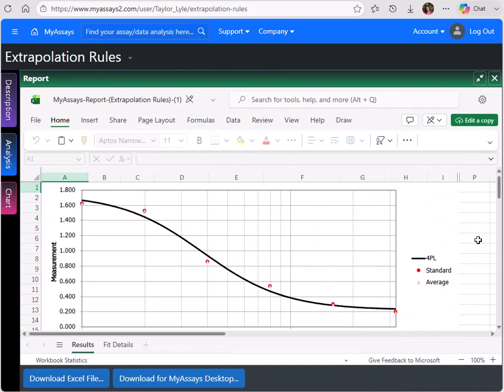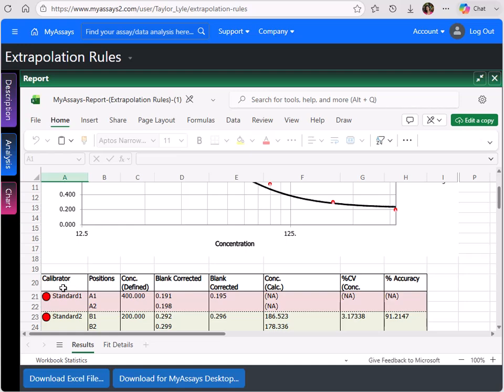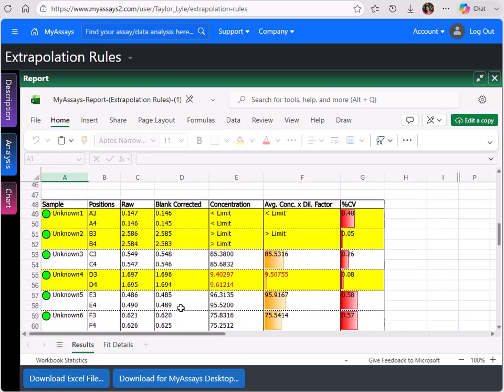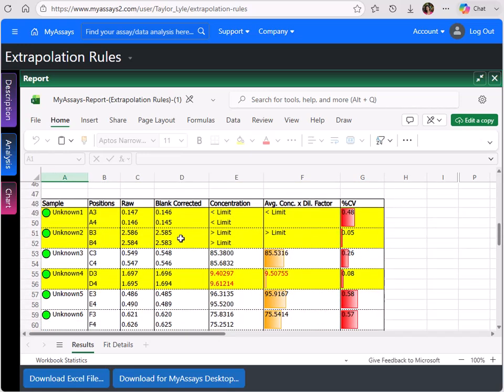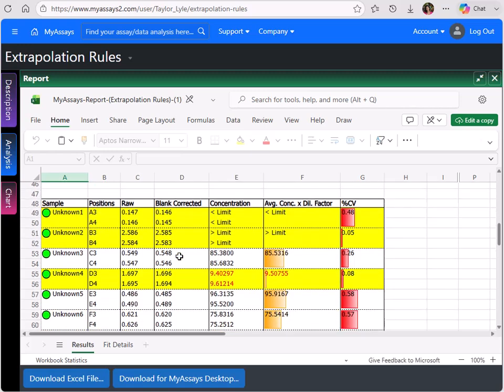On our report, you can see these extrapolation rules applied. Unknowns 1, 2, and 4 are highlighted in yellow. Looking at the blank corrected values, we can see unknown 1 has values of 0.146 and 0.145. These are lower than the values of the lowest standard, standard 1, 0.191 and 0.198. Unknown 2 has blank corrected values 2.585 and 2.583, which are higher than the highest standard, standard 6, which has values of 1.621 and 1.620. Unknown 4 also has blank corrected values higher than the highest standard.